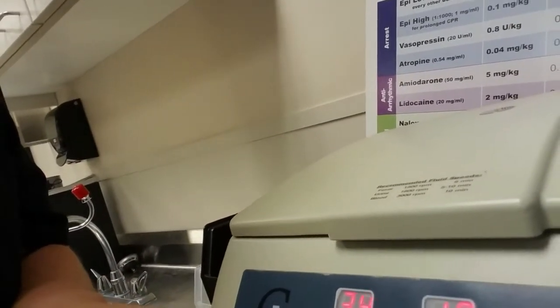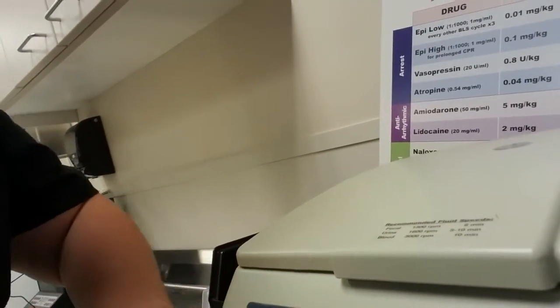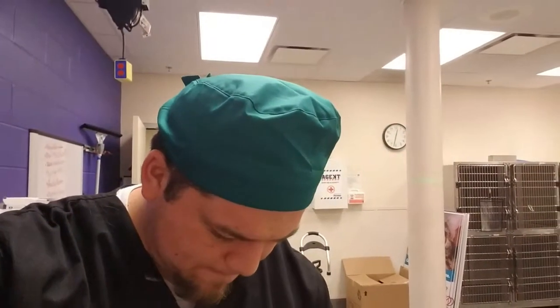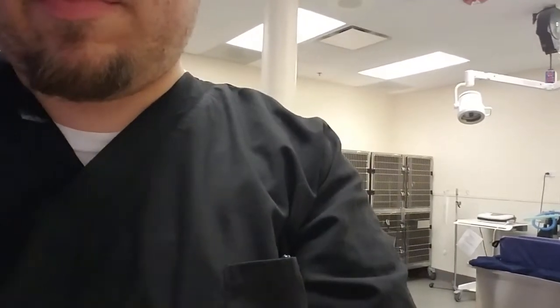So I'm going to go ahead and change that to 5,000 and lower the time to eight minutes. Opening that up — I'm putting it in right now, directly across from each other. I'm putting it in the third slot and the one right across from it, which is number seven. I'm running that right now and I'll be back in approximately eight minutes and then I'll show you how to do the PCV and get the total protein.